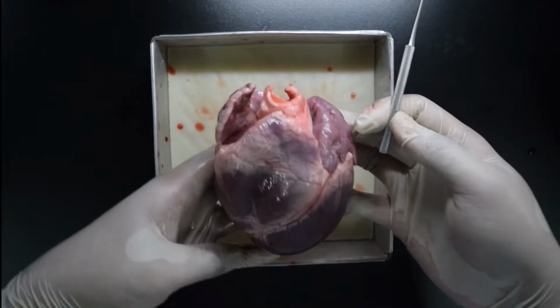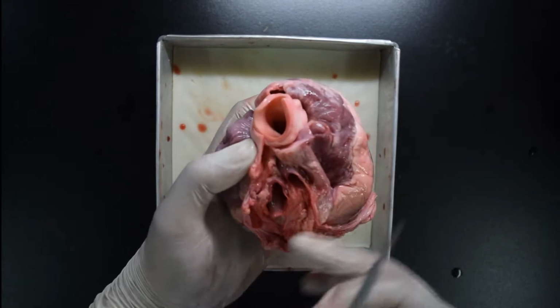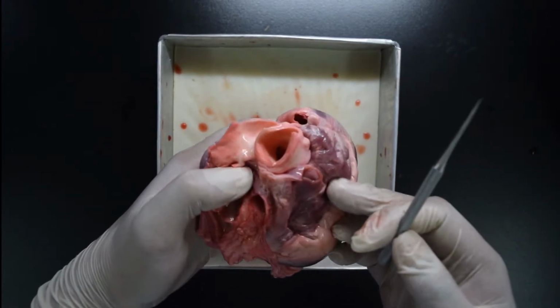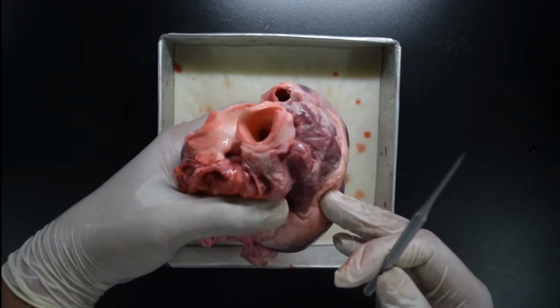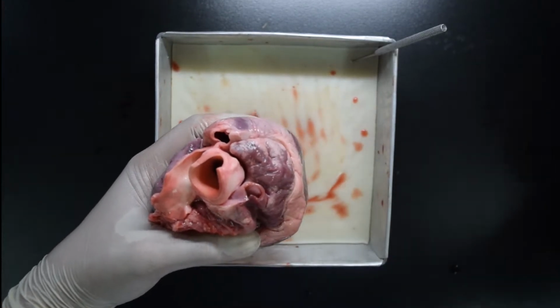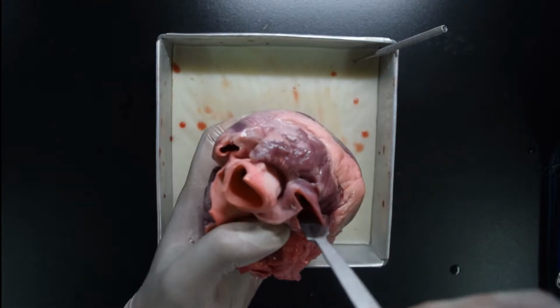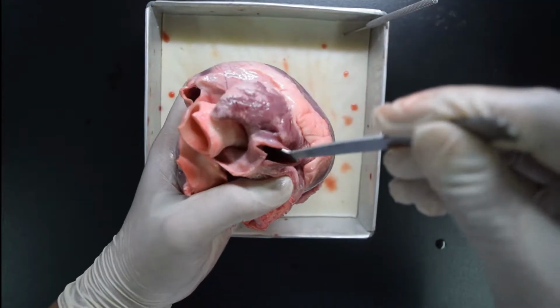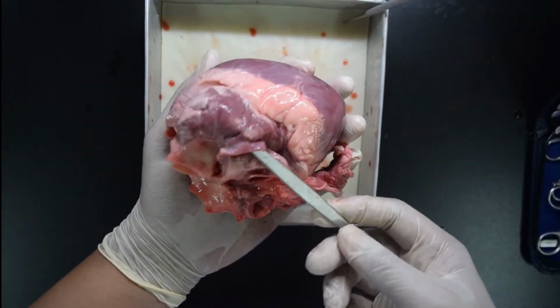Now how about the major blood vessels that can be found in our heart? Here you see several tubes or opening blood vessels. We will identify each. Let's start with the inferior and superior vena cava. In this kind of heart that I purchased from the market, you cannot see anymore the superior and the inferior vena cava, but you can see the tube that leads to the right atrium. This tube is your vena cava. How do I know it's the vena cava? Because it leads directly to the right atrium. This is your vena cava. It collects deoxygenated blood from the body, returning it to your heart. You see it's directly connected to the right atrium.